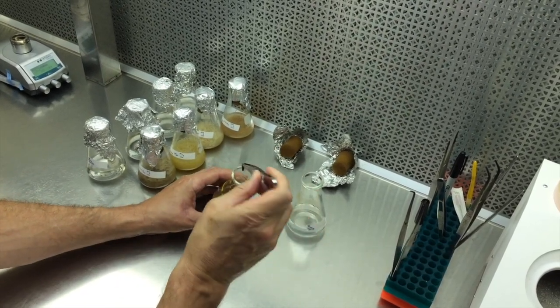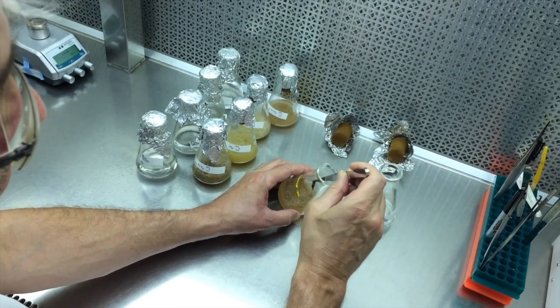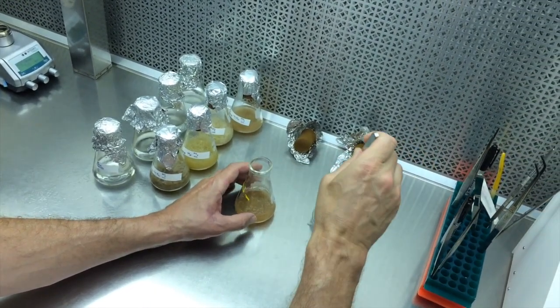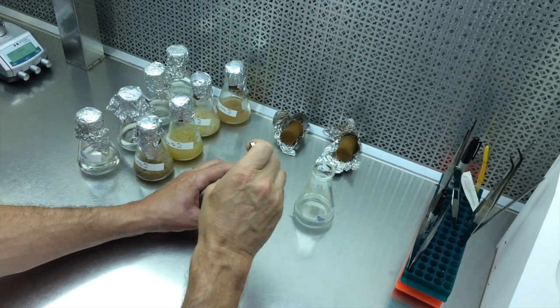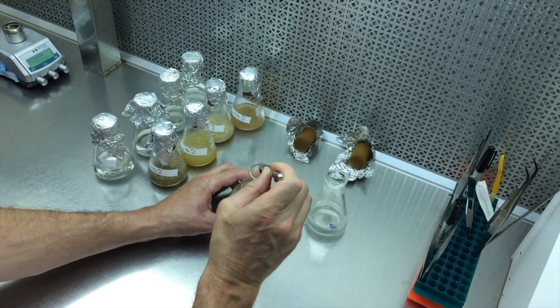And here the trick is to go in along the surface on the edge, like right in about there. Yank it. It's kind of like plucking your eyebrows, even. That's what I always tell people, even though I've never plucked mine. It'd be painful if you did it slowly.